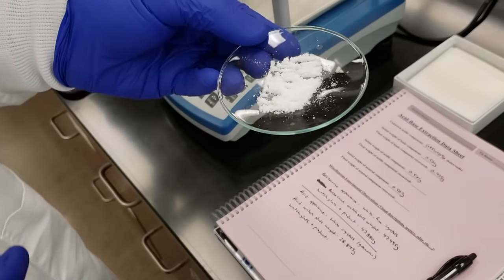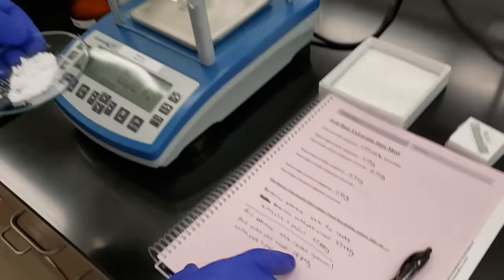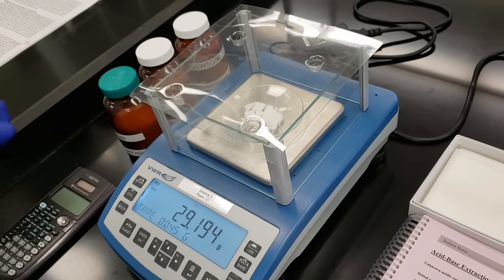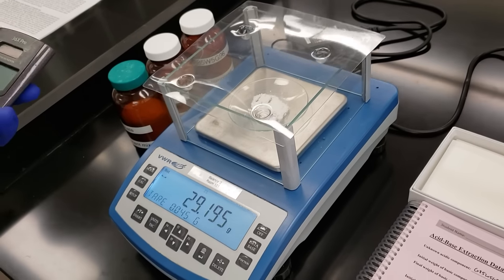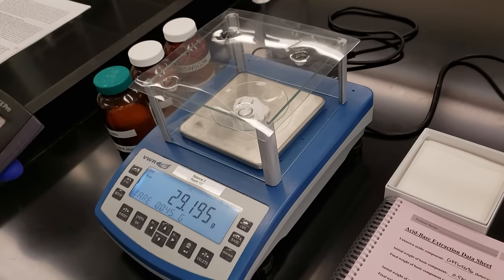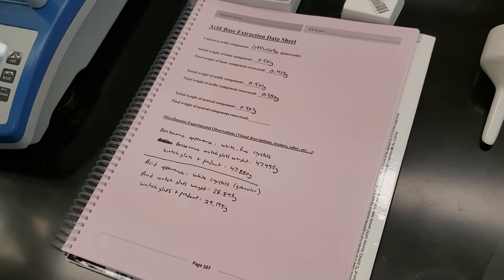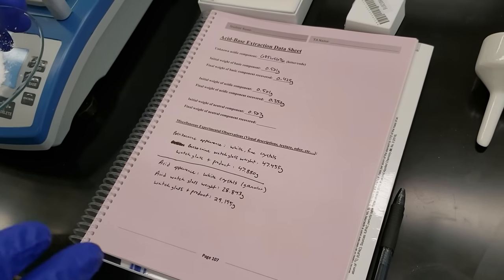We've retrieved our crystals from the drying oven to drive off any remaining water. Our watch glass was pre-weighed at 28.843 grams. We go ahead and weigh: 29.195 grams. So 29.195 minus 28.843 gives us 0.352 grams of our acidic component recovered. You use those values to do your percent recovery calculation. We'll keep these separated and labeled, and go ahead and isolate the neutral component.